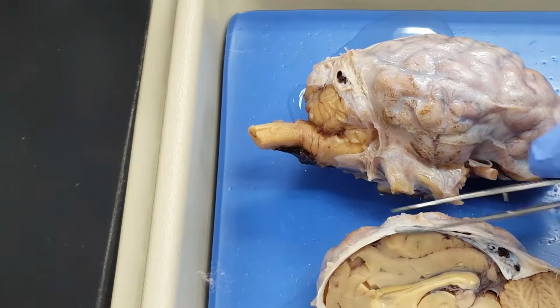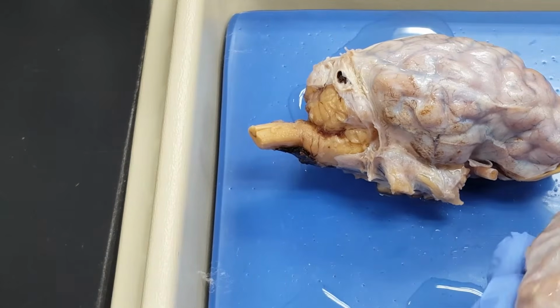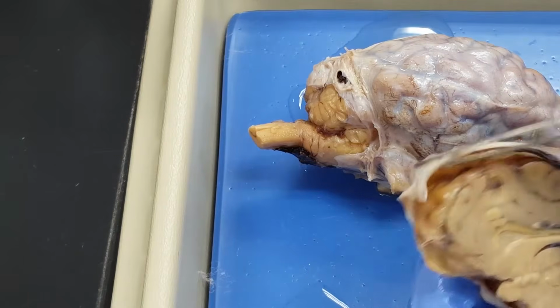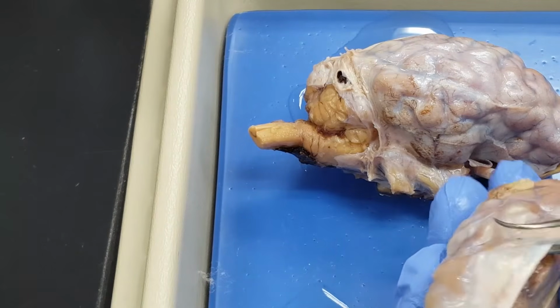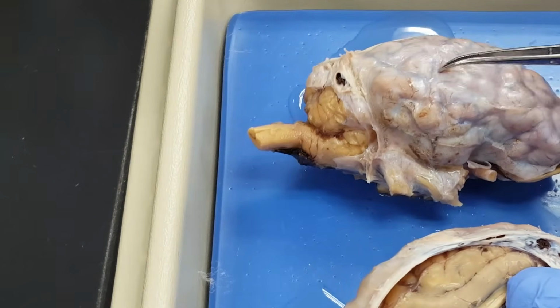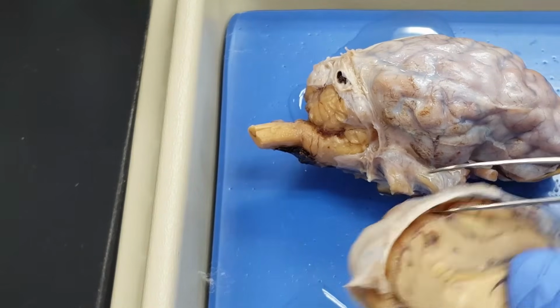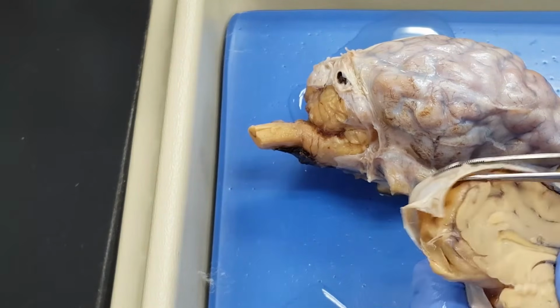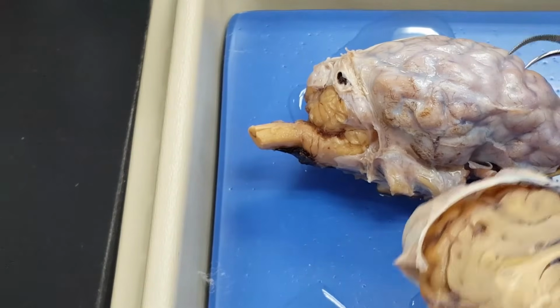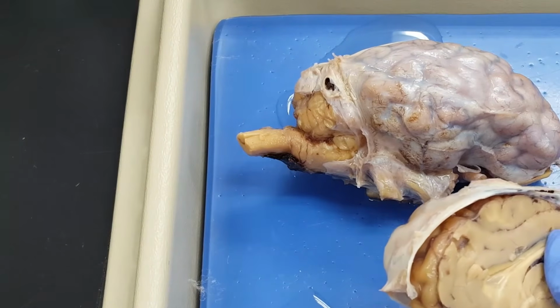with an examination of this material right here. You will hear about it in your lecture. This is the dura mater right here. Look at how thick it is. Look at how white it is. I can see it all over this brain right here. Dura mater. And yes, you say mater, not matter. The dura mater, lots of tough, strong collagen here. So this is the outermost of the 3 meninges, the dura mater.